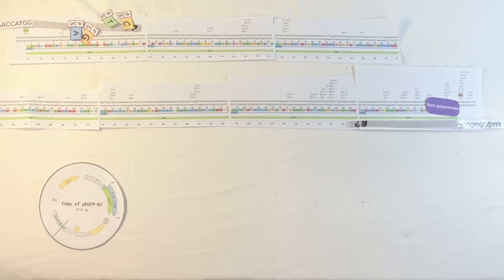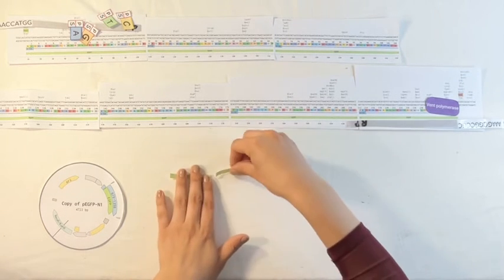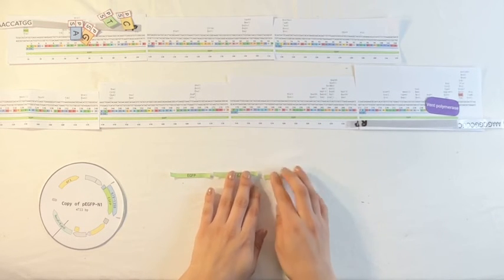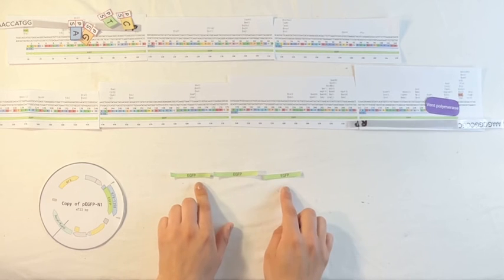Through this PCR process, we're going to get an expansion of this EGFP gene.